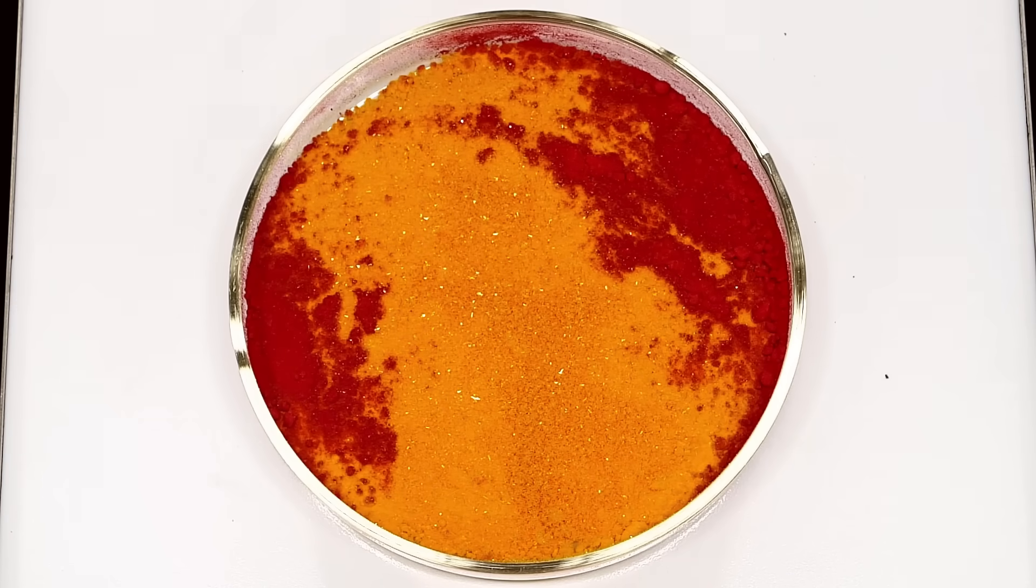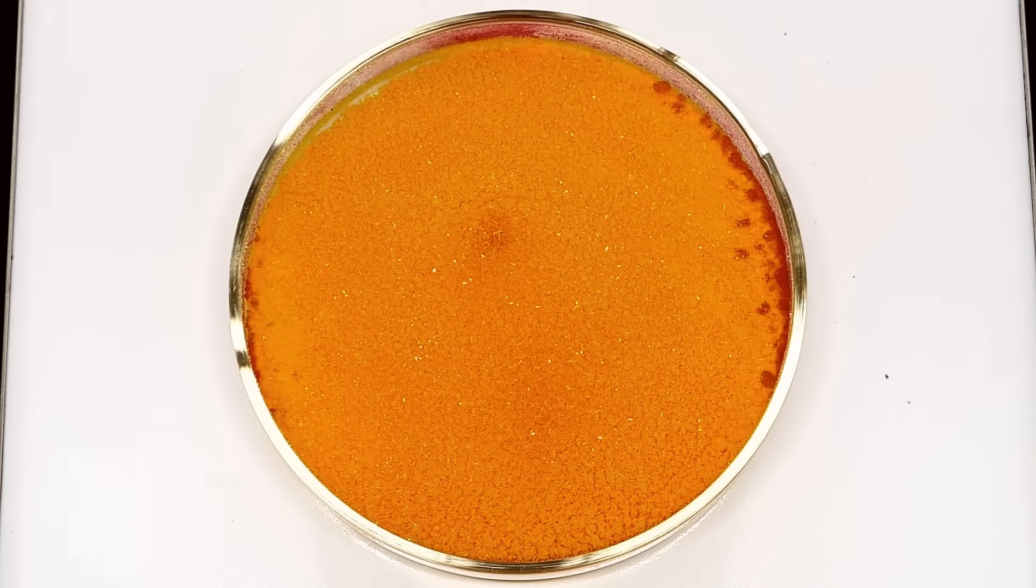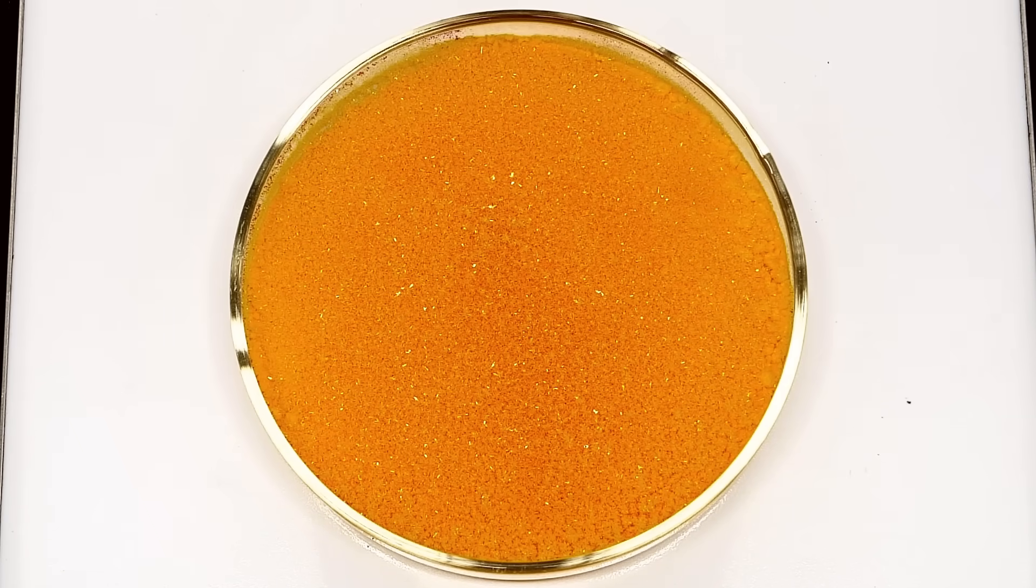It ended up taking a lot longer than I thought, but I was eventually left with a completely yellow powder.